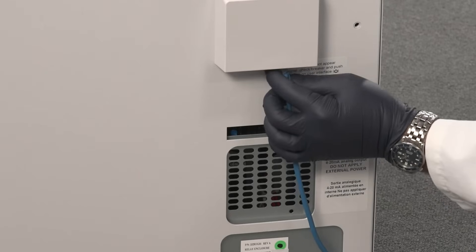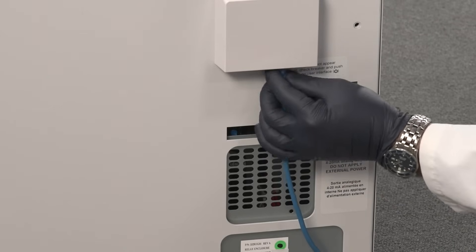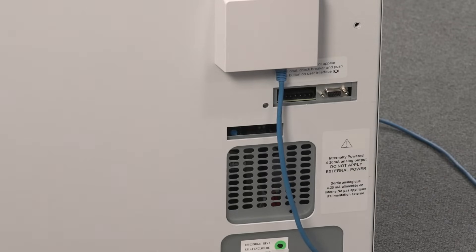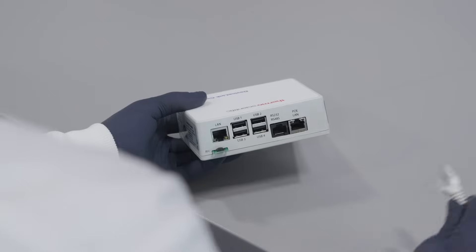Others, like our Thermo Scientific DeviceLink Connect and Insight solutions, can be powered over Ethernet.